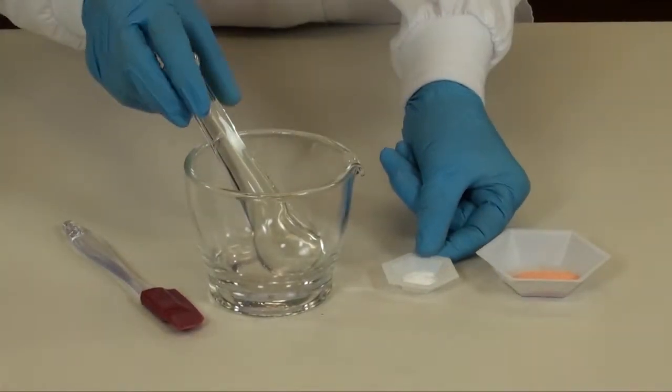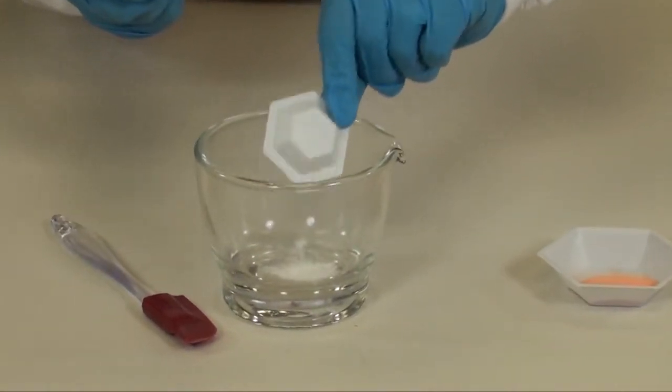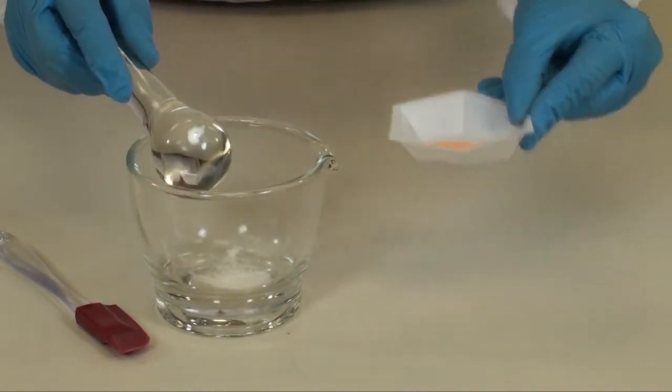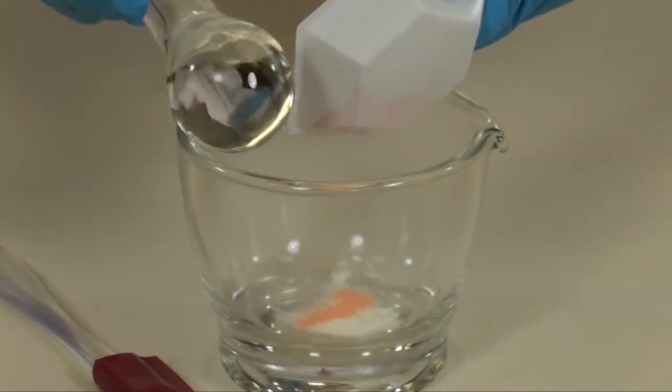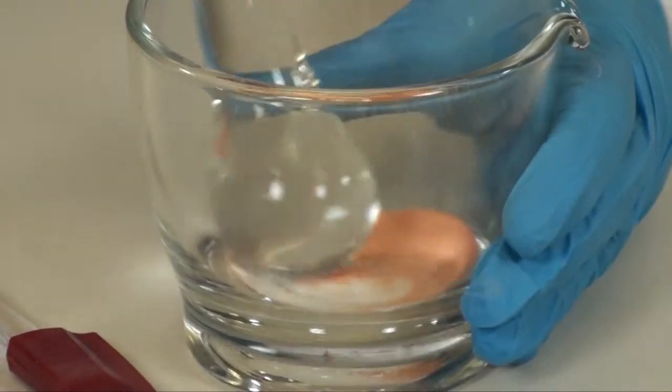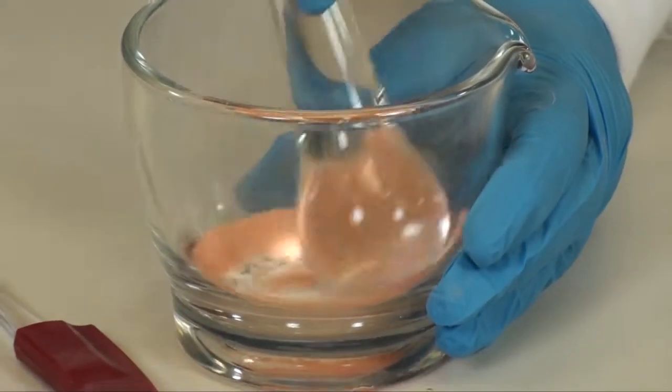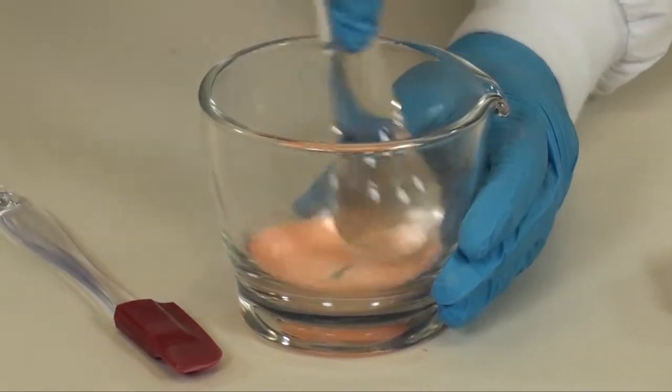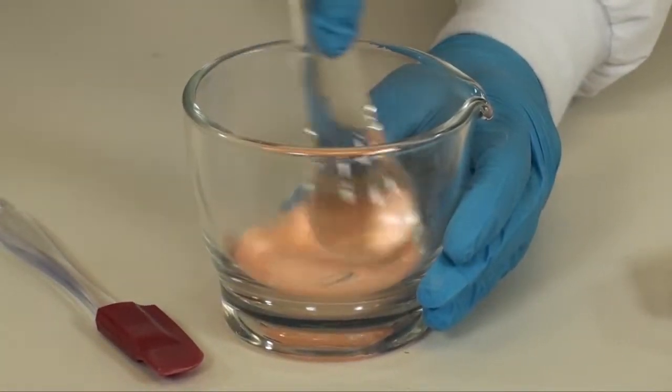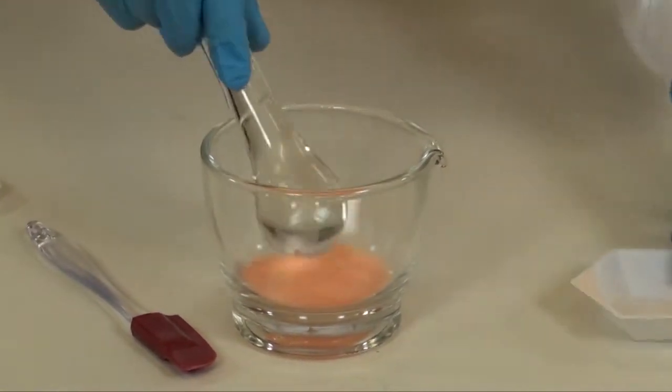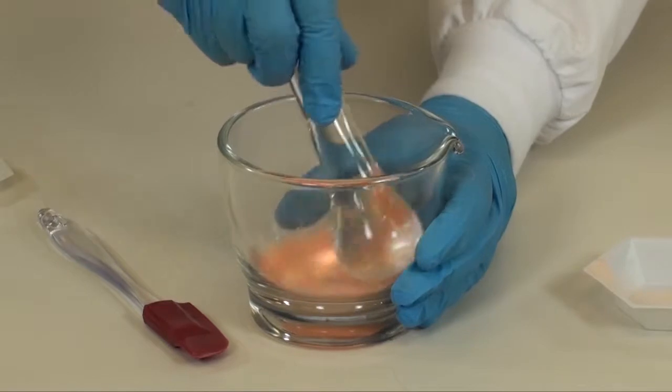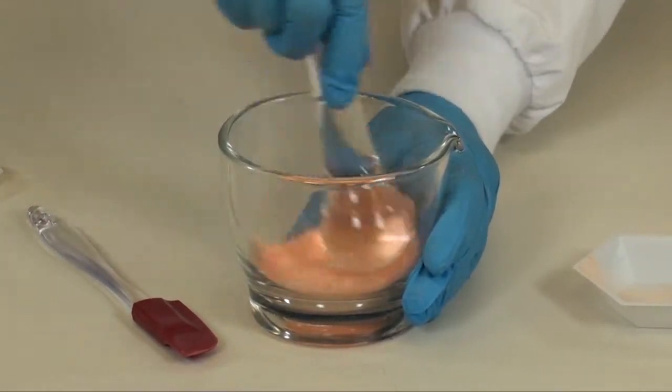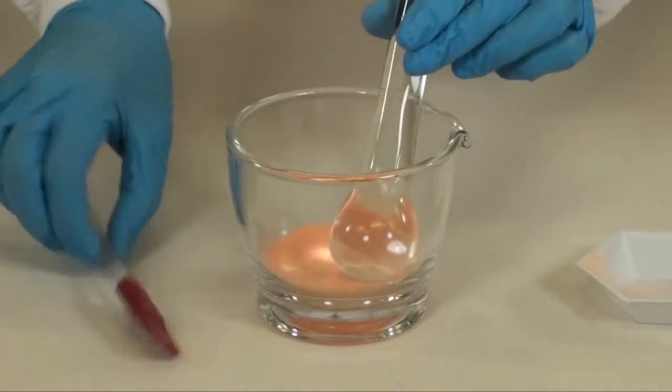Place the hydrochlorothiazide capsule powder into your mortar and geometrically mix the allopurinol powder with the hydrochlorothiazide powder. These powders are already very fine powders, so forceful trituration is not needed. Your end result will be a uniform, fine powder mixture. If you need to scrape down the powder, use your rubber spatula.